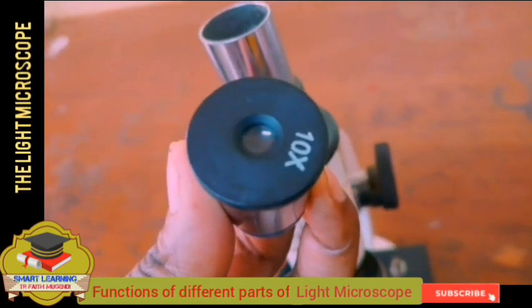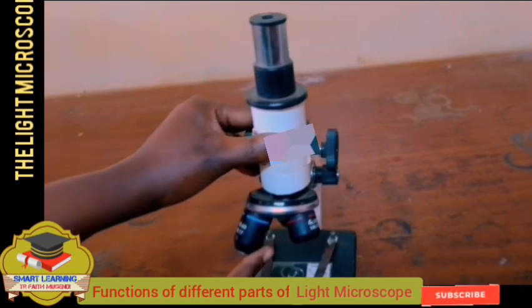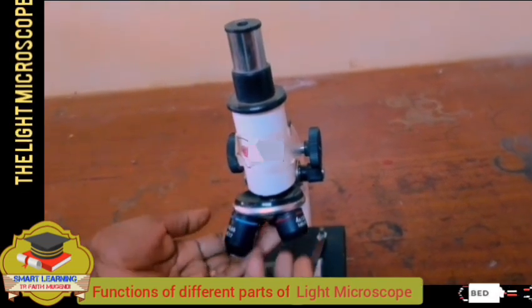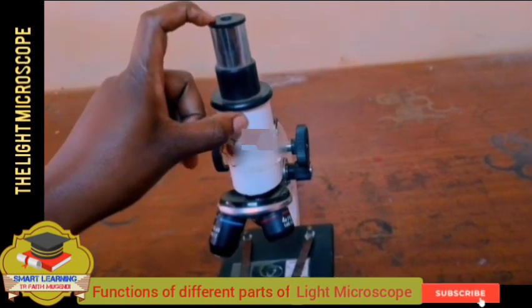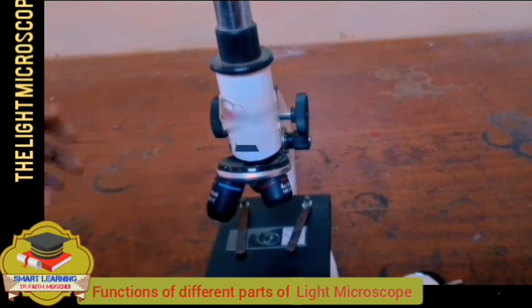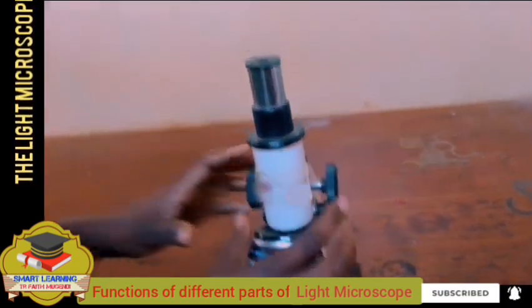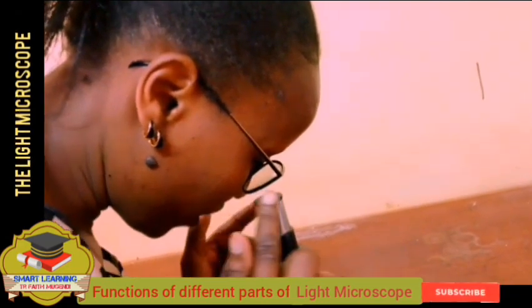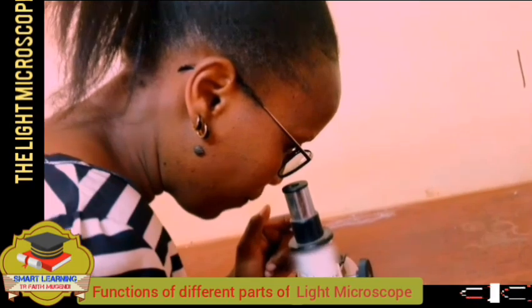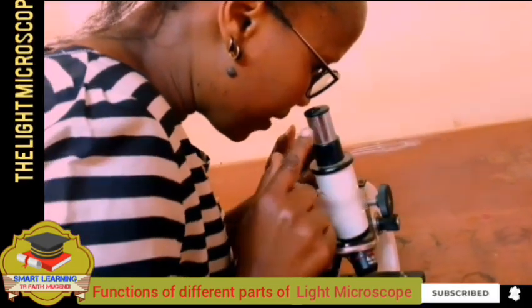This eyepiece has a magnification of times 10. Remember, there is some magnification that is taking place here, and then the image that is formed is further magnified by the eyepiece and then projected to the eye. When we are using the light microscope, you place your eye here like this. So whatever we normally see is first of all magnified by the objective, then the image formed by the objective is then magnified by the eyepiece.